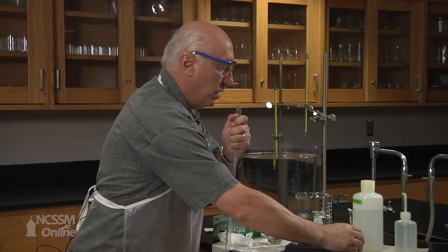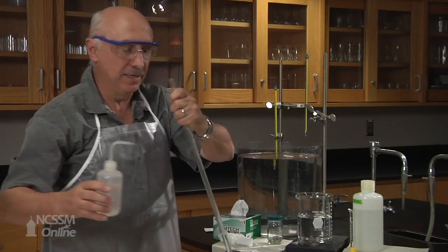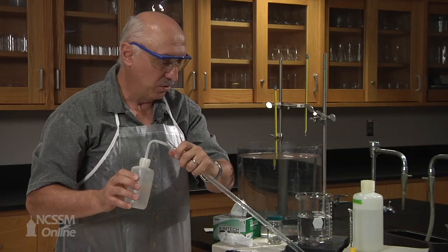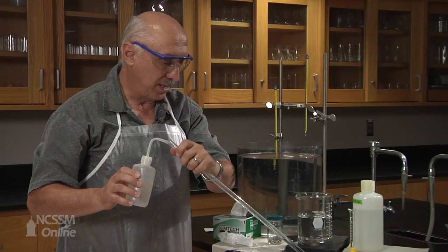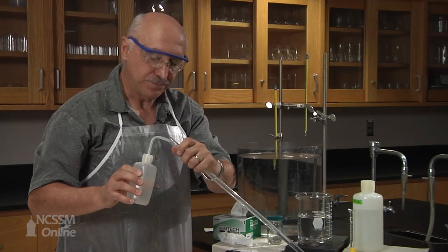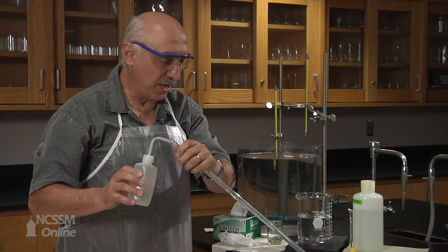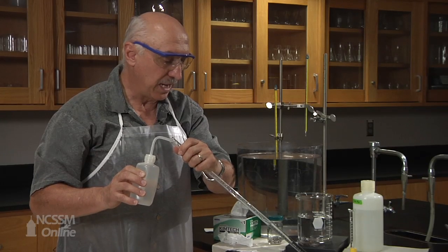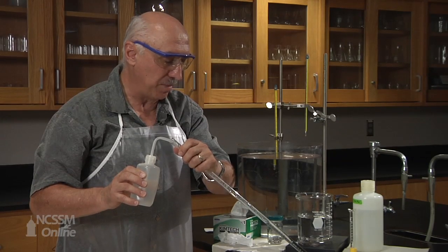And then we will gently add distilled water to our gas measuring tube. And we will do so gently because we do not want the water to mix with the hydrochloric acid. We want the hydrochloric acid solution to remain at the bottom.